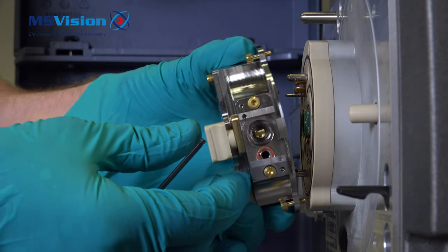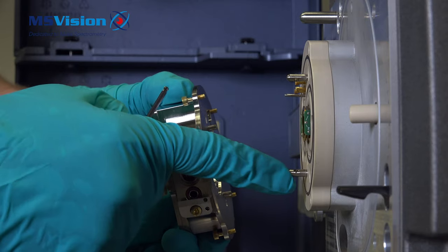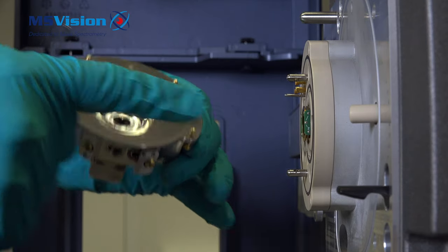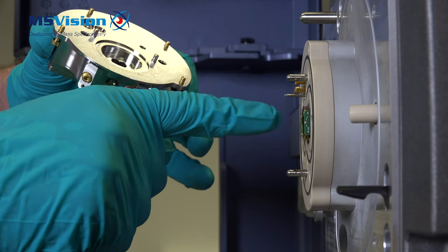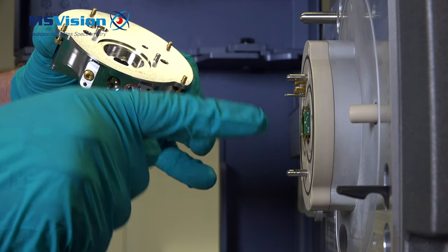Align all the holes. These pins are for alignment. Here, these are electrical feed throughs for the heater and for the temperature sensor and cone voltage. There's a temperature sensor.